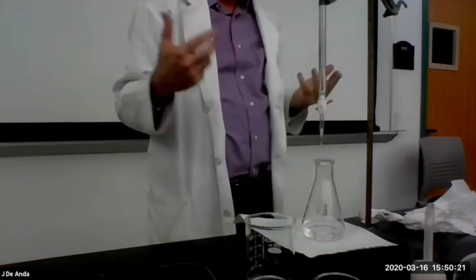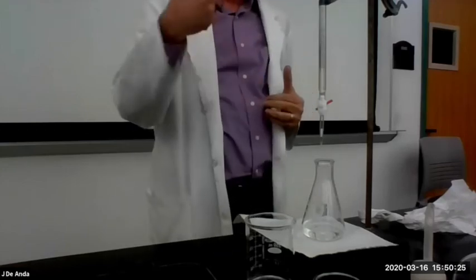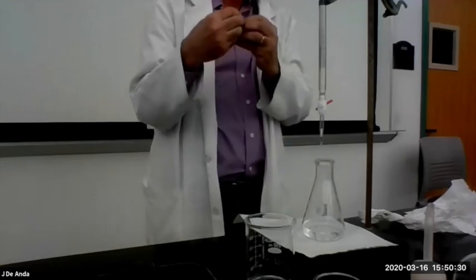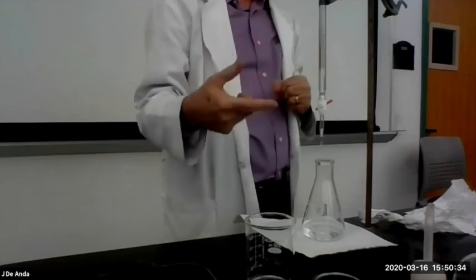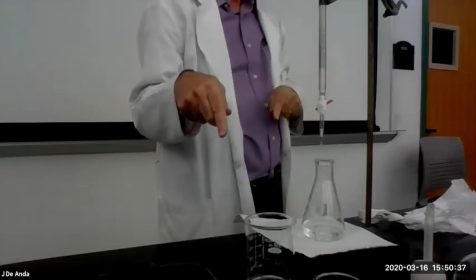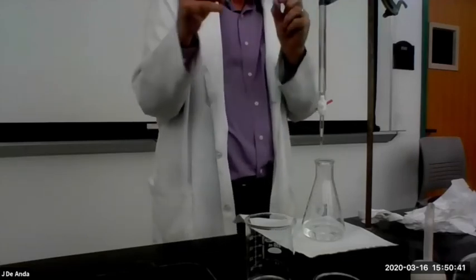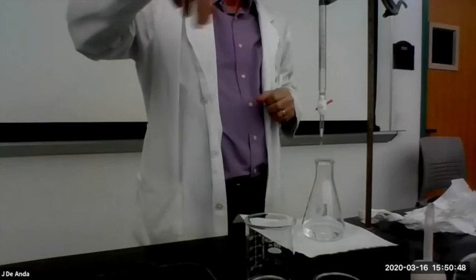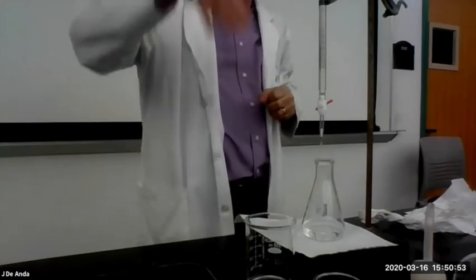Now remember, the idea is that as the KOH reacts with the acid, it starts neutralizing. At some point, the acid is going to be so far reacted that the base is going to start reacting with the indicator instead. And the indicator is going to start changing color. But because there's still so little of it, it's going to be like a faint color and then disappears. So as I go through, I'm going to watch these swirls of pink color form and disappear, form and disappear.